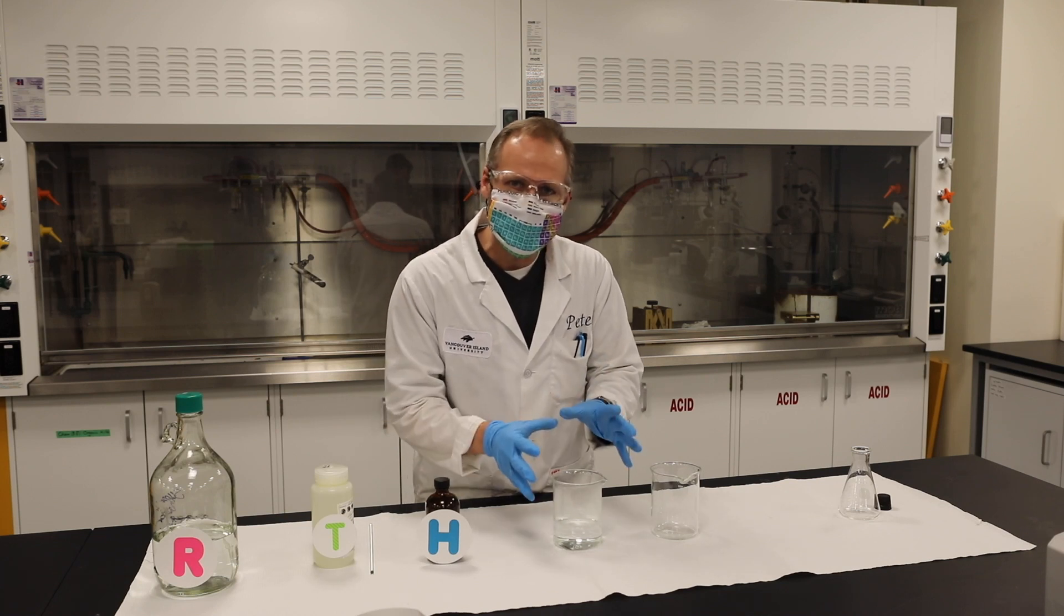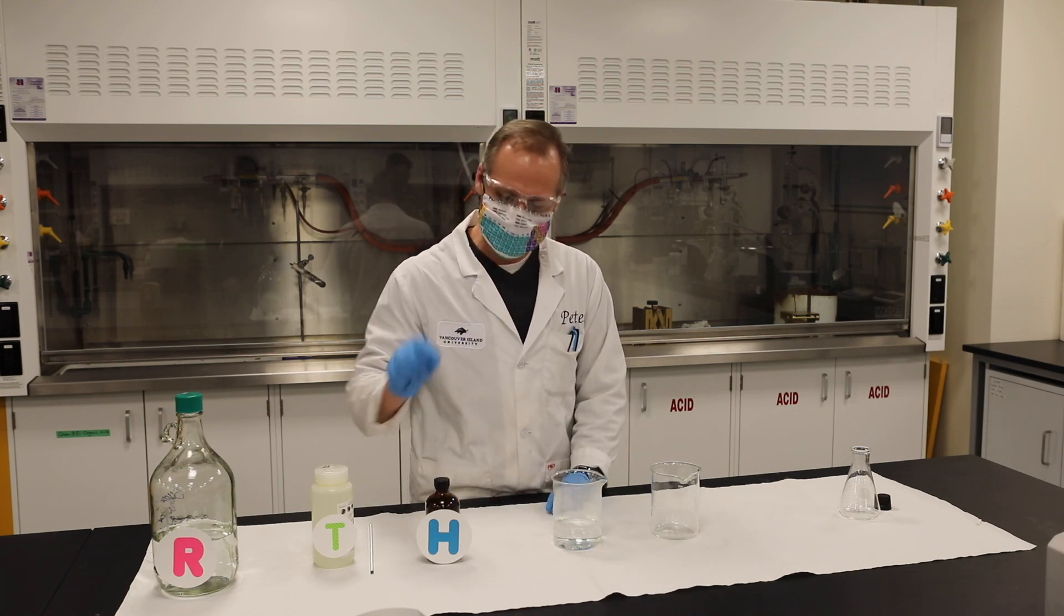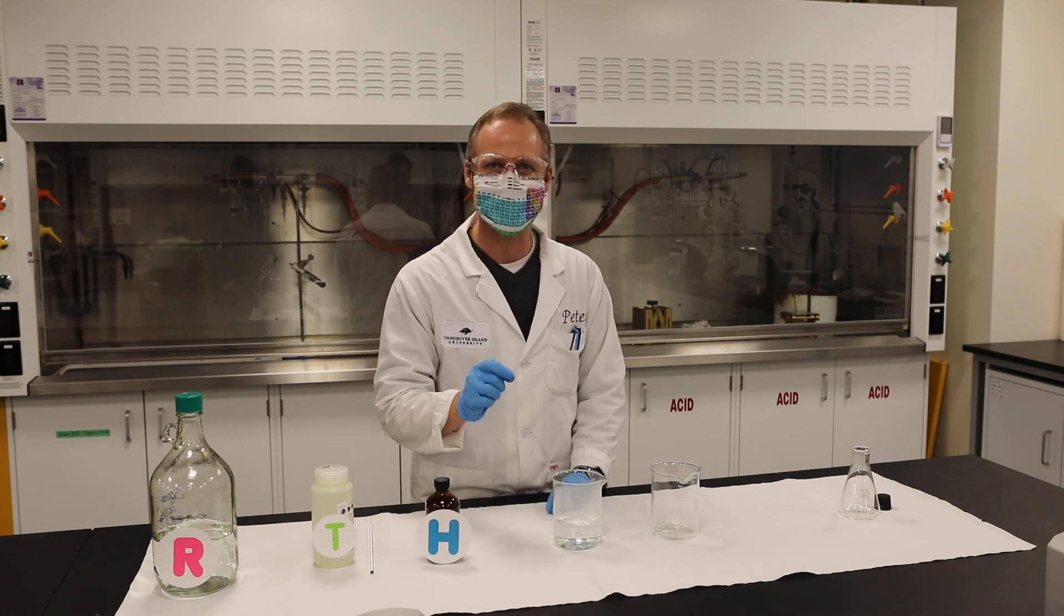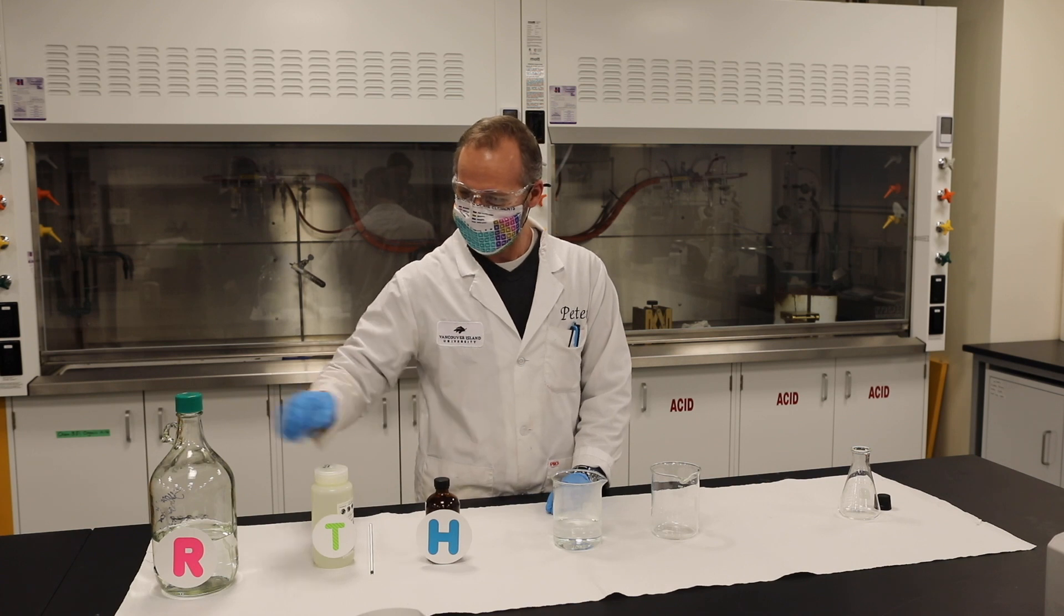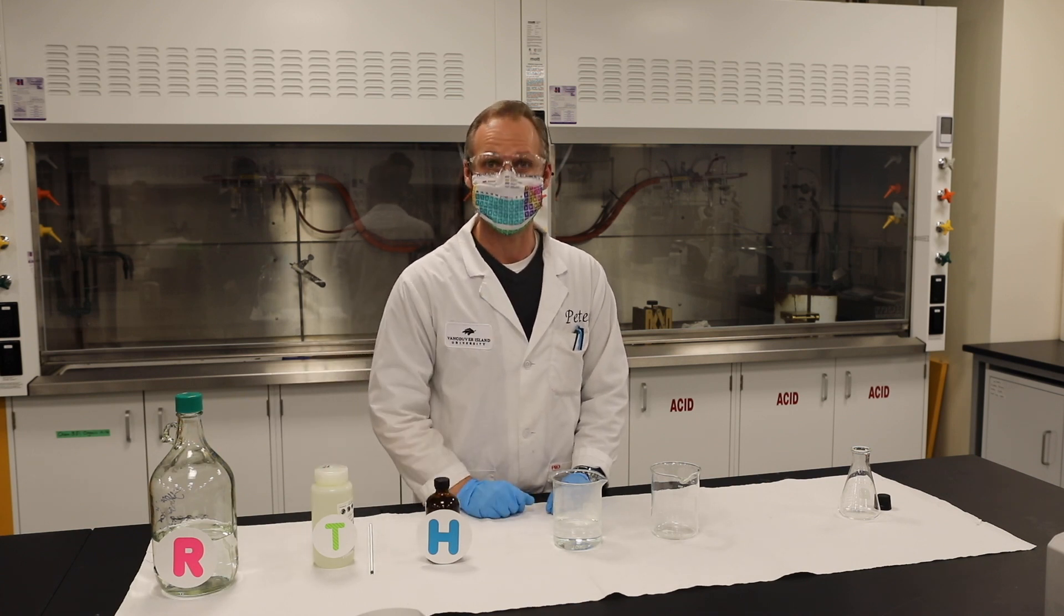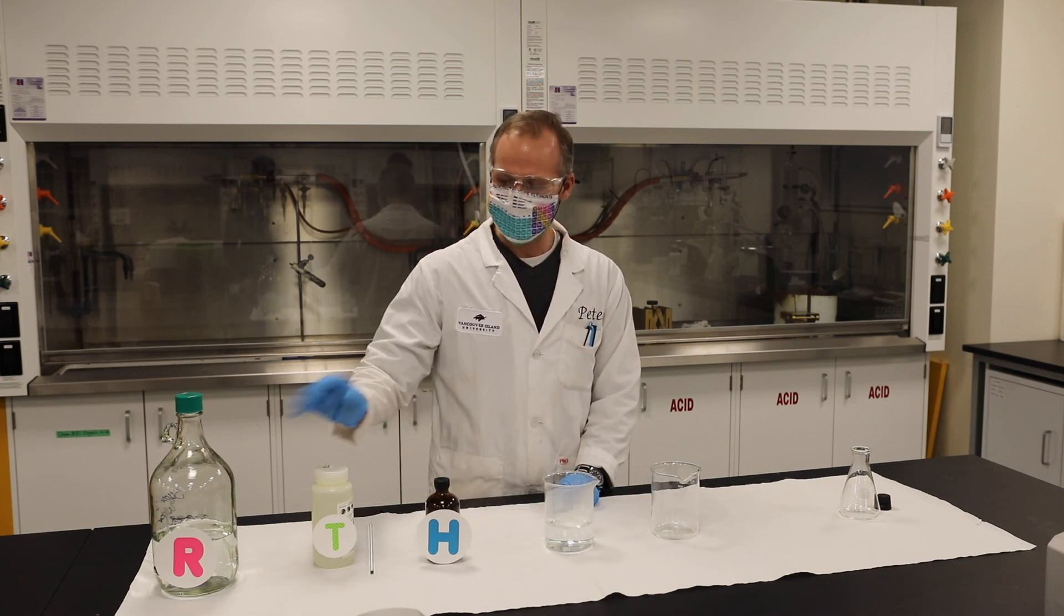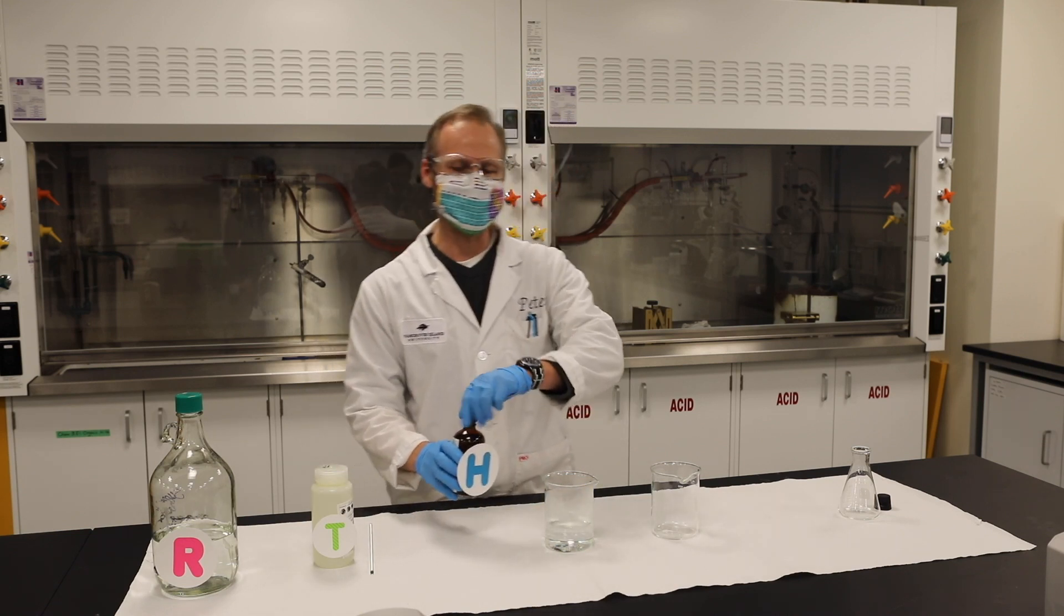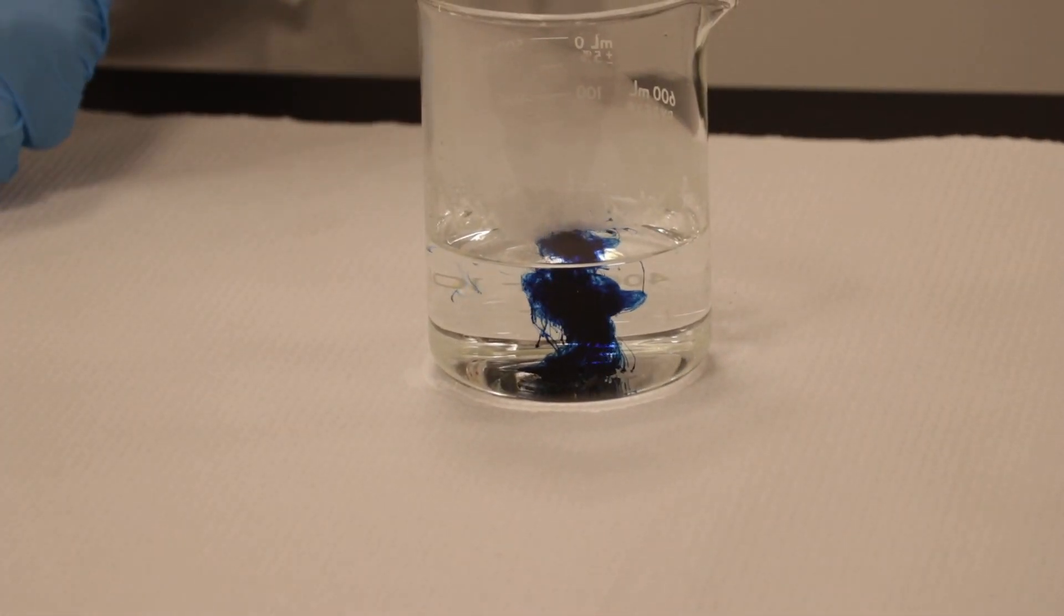So what I'm going to do is I'm going to mix it together, and it's going to start a reaction. But the thing is, I'm going to use this indicator to monitor that reaction. And as it consumes a bit of oxygen from the air and some of the sugar with the sodium hydroxide, it'll change color. It'll be really neat. So I've already got the sugar water here. It's warmed up. I'm going to add a bit of dye, indigo carmine. That's better. That's blue.